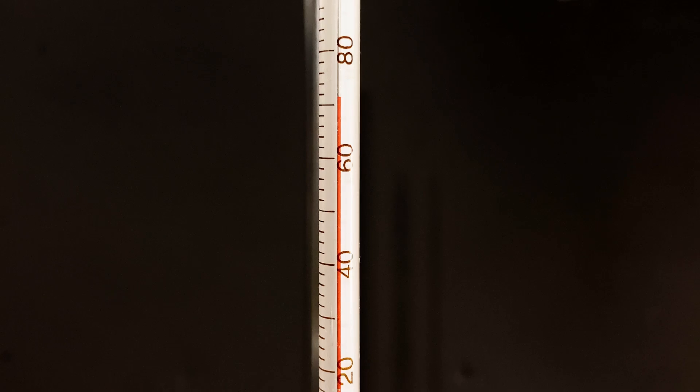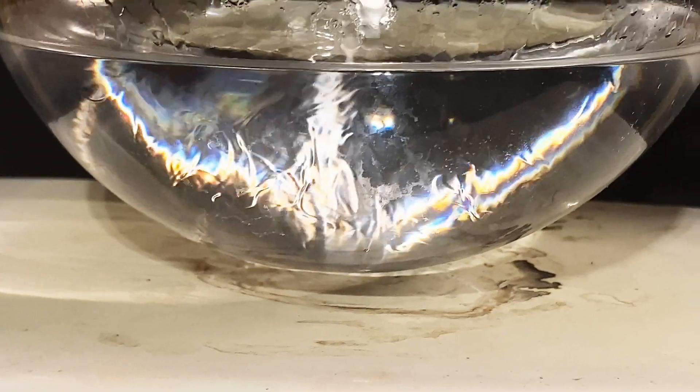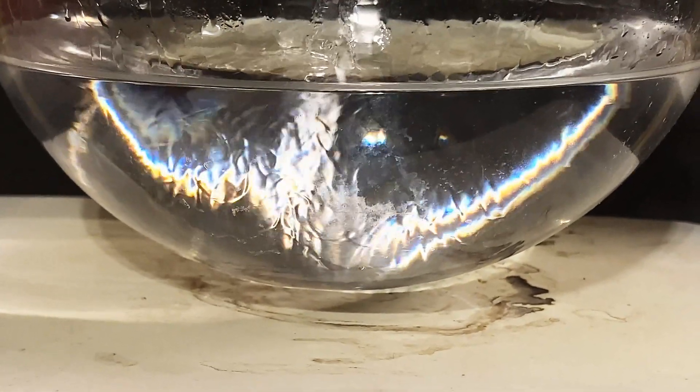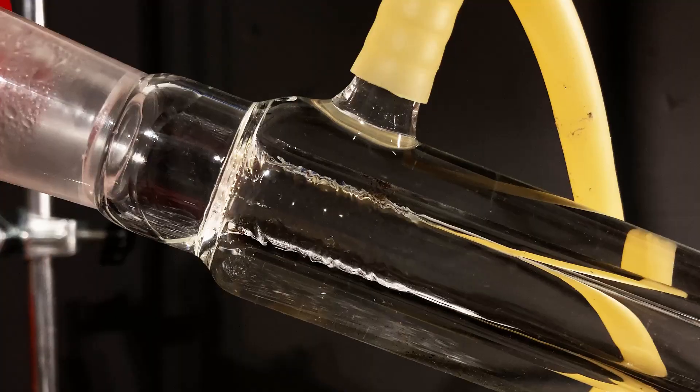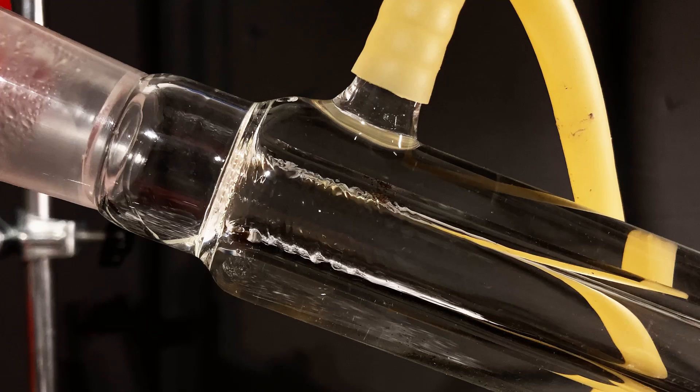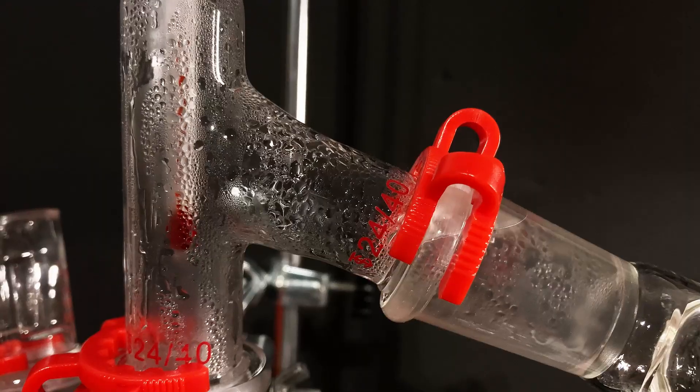Due to the different densities of the liquids in this sanitizer, we can see these nice patterns, so I thought it was pretty cool to show you. I let the distillation run at a few drops per second, and the beaker gradually filled up with the isopropyl alcohol and water mixture.